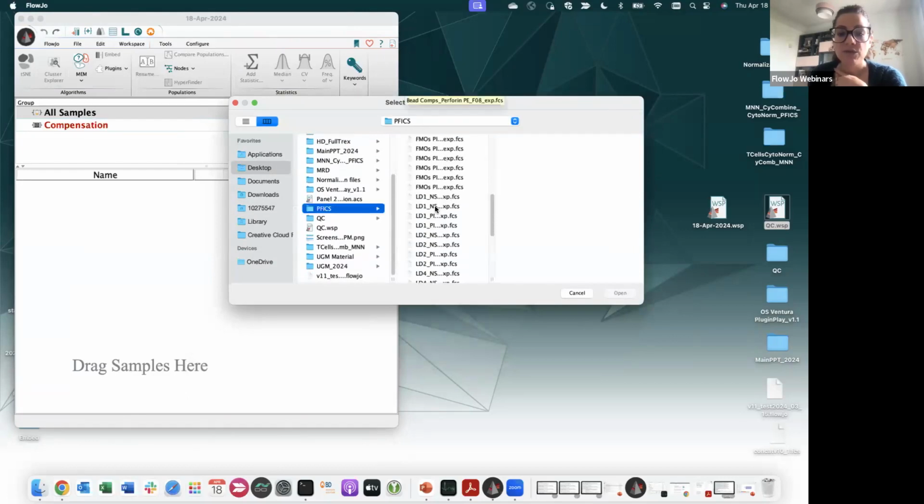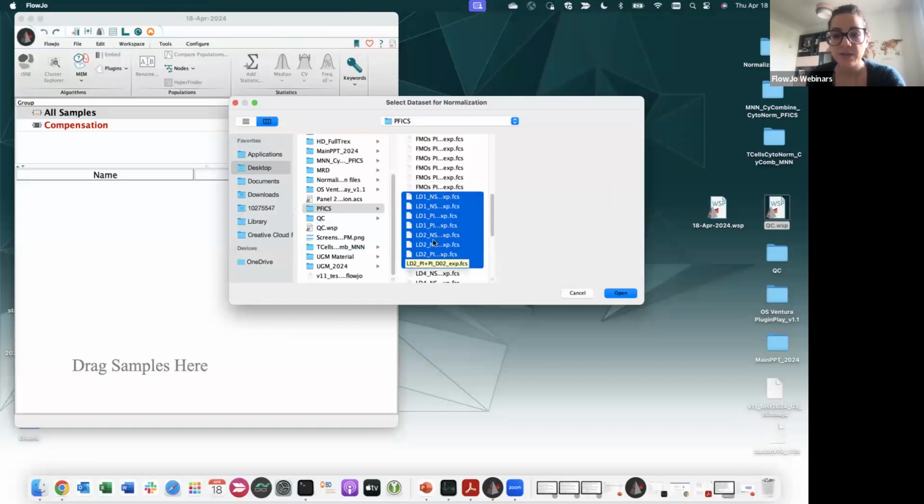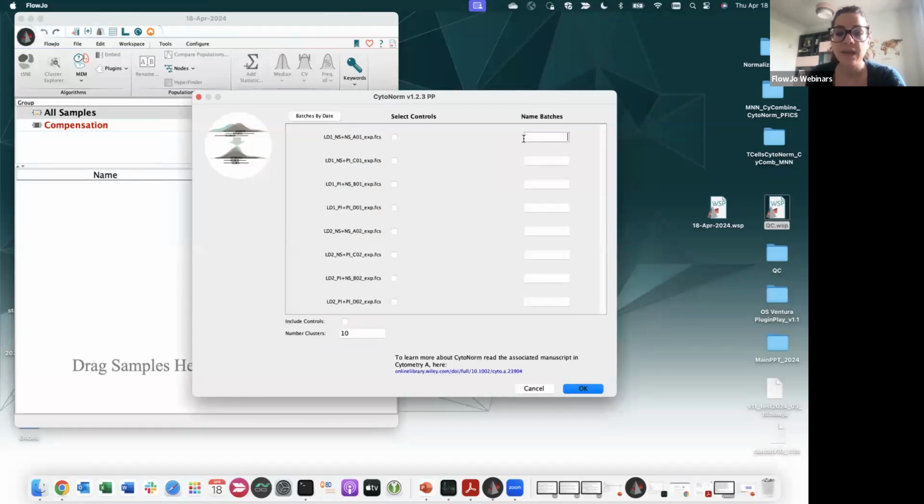Let's say that I want to normalize my 4 batches. I have 4 different batches with 2 samples each. Yes. Okay. So I can click open. And now I will tell it, these are my controls. Okay, so these are my controls. And then the batches will be batch 1, 2, 3, and 4. So I have a control for each batch. And then the reference to normalize would be the second sample in batch 1, in batch 2, in batch 3, and in batch 4. So I have a relative sample in each batch that I want to normalize to my control. So then you can click OK.